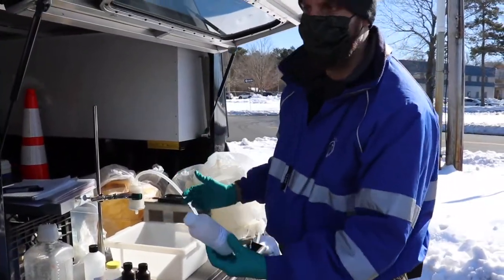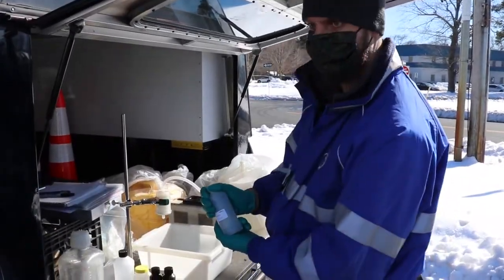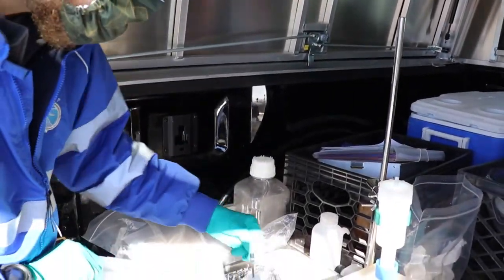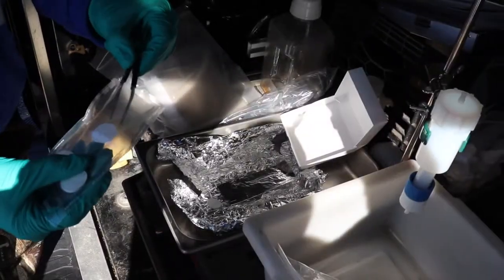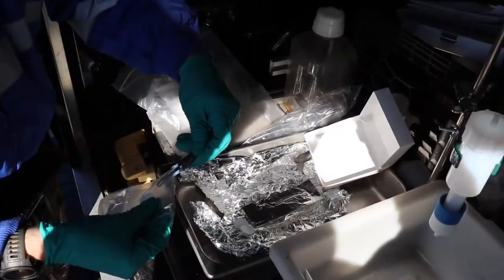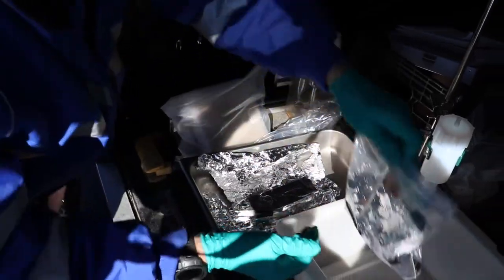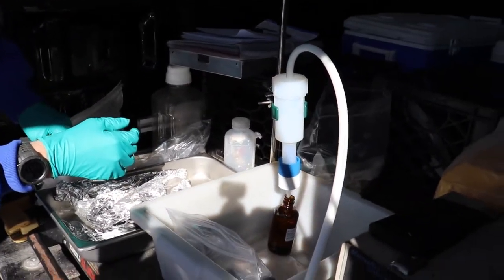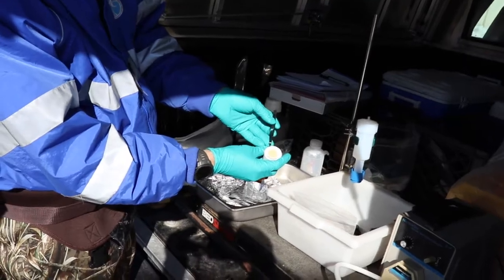Each bottle has different colors for different reasons. Brown will be so that the sun doesn't get through and degrade the sample with sunlight. This is acid rinse for metal parameters. Typically what we're doing here is collecting the total and dissolved organic carbon components of the stream — things that might be influenced by, like, the leaves you see entering into the stream. We're going to take three filters. You can tell it did pick up a lot of the iron floc that we saw within the stream.